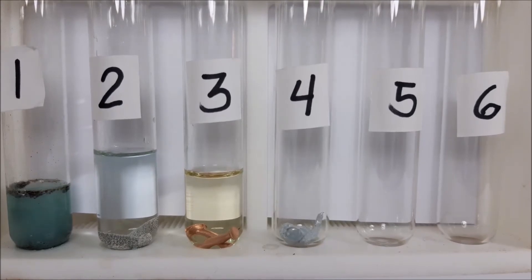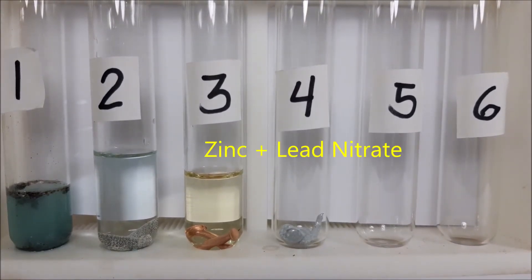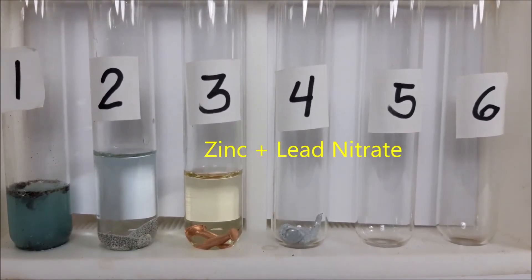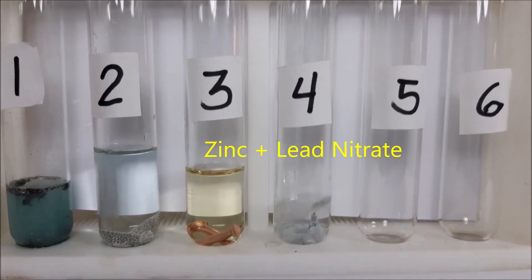For test tube number four, I will put zinc and then I will add lead nitrate. Let's see what will happen.